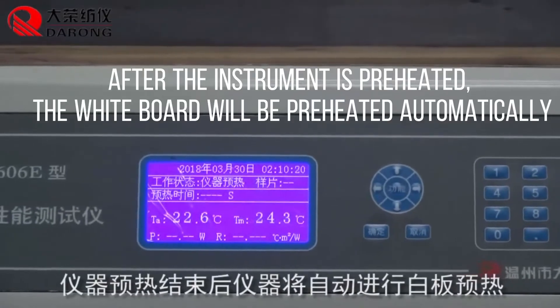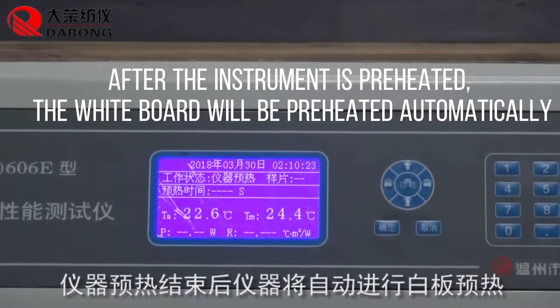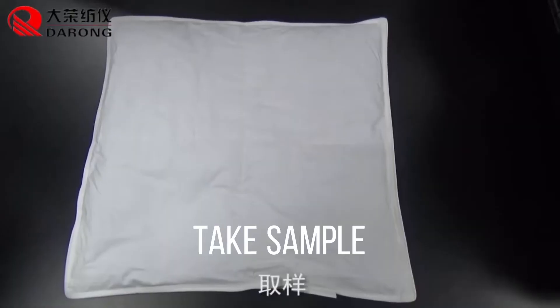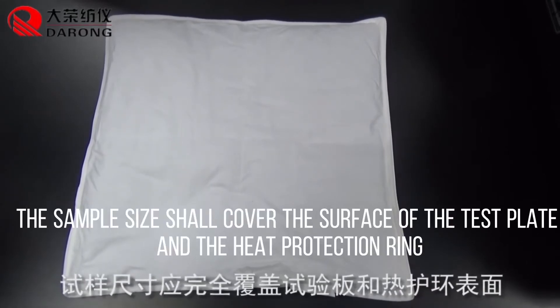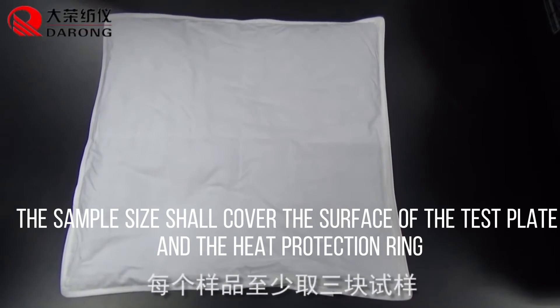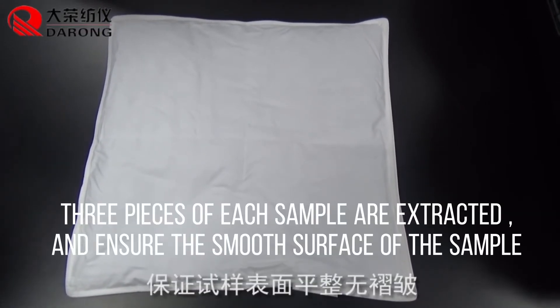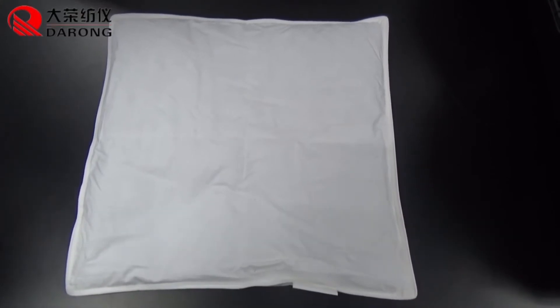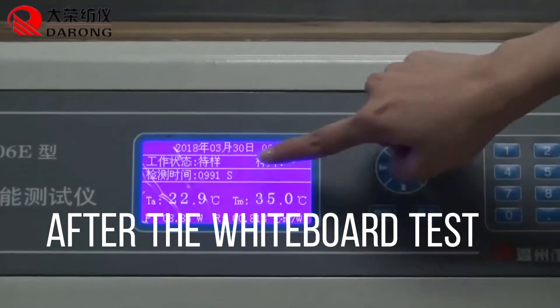After the instrument is preheated, the whiteboard will be preheated automatically. Take the sample — the sample size shall cover the surface of the test plate and the heat protection ring. Three pieces of each sample are extracted; ensure the smooth surface of the sample.